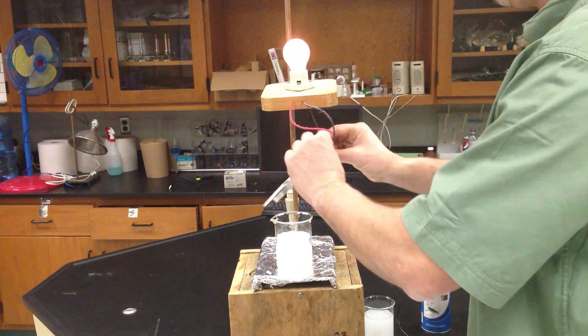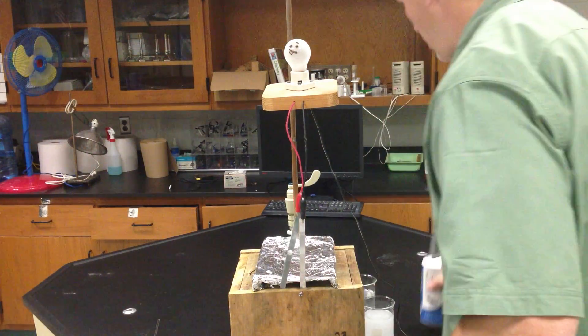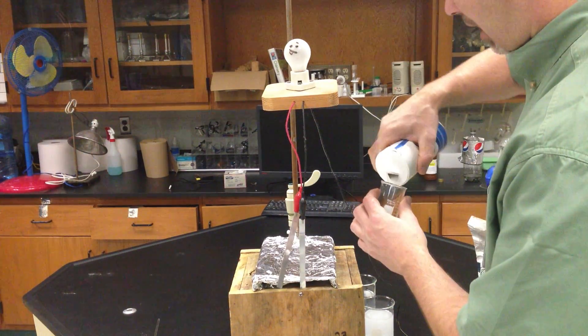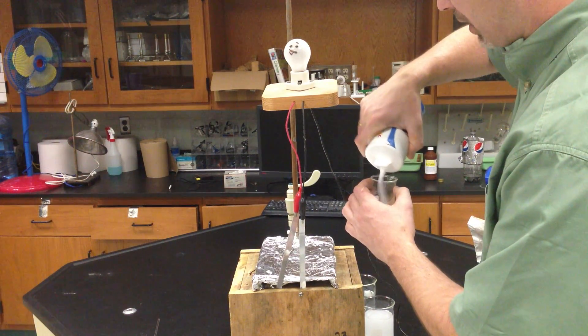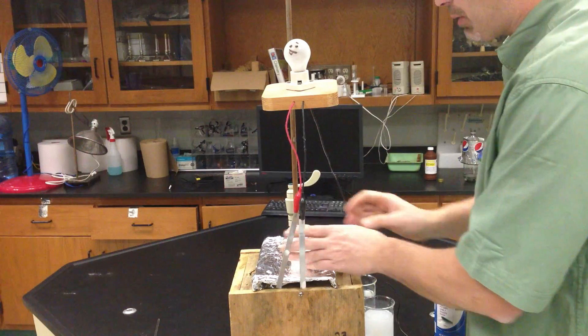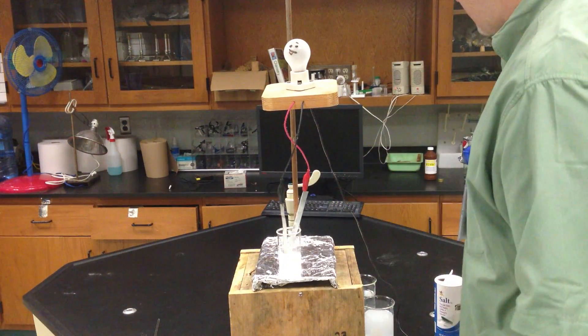And one last test. Let's take this off. And let's add some solid sodium chloride. We notice that aqueous sodium chloride and also liquid sodium chloride would conduct because the ions are free. But if I put solid salt here, stick the electrodes in, the solid doesn't conduct.